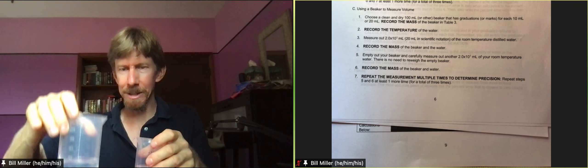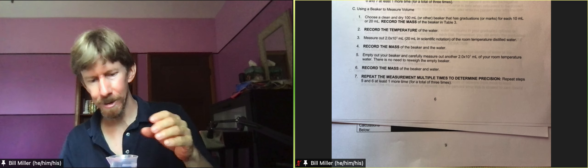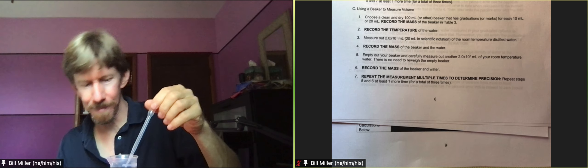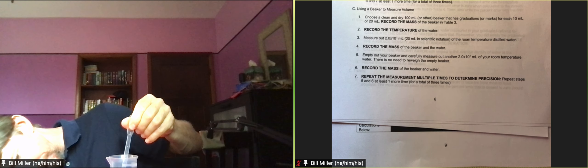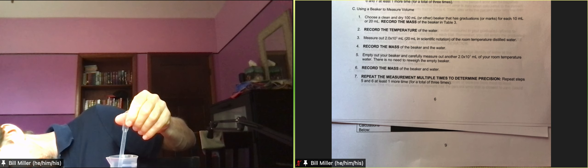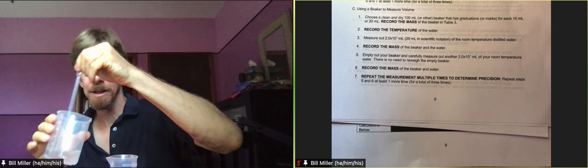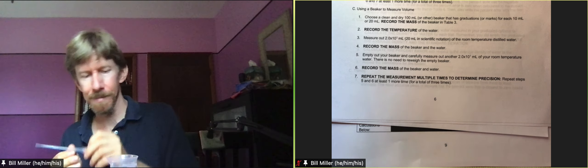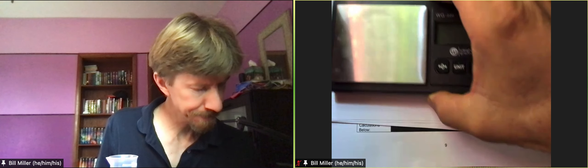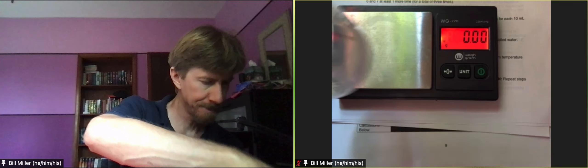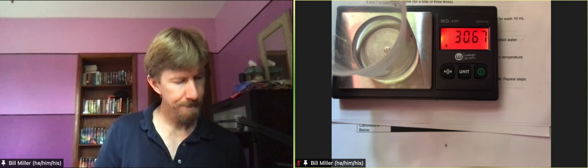So I'm going to pour the extra into my waste. And let's see how we're doing now. Still a little high, so I'm going to get my pipette out. I'm going to actually suck some out this time. And it looks right on the 20 mark right now. So now I'm going to weigh it. 30.67.